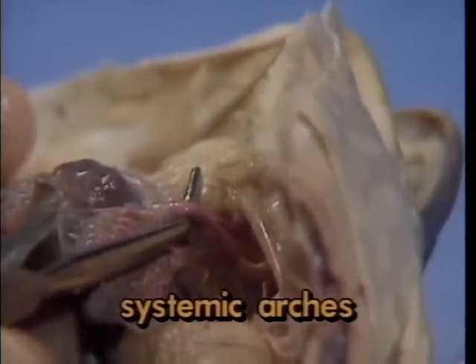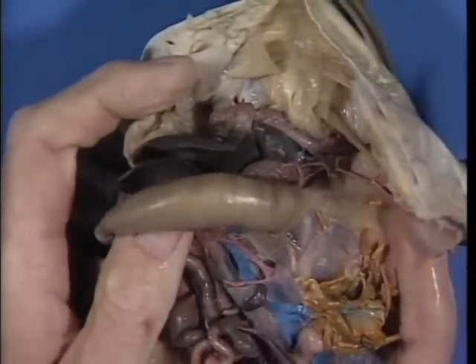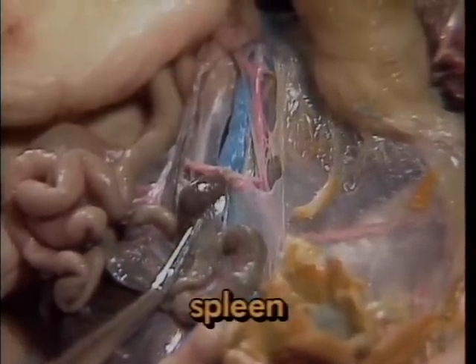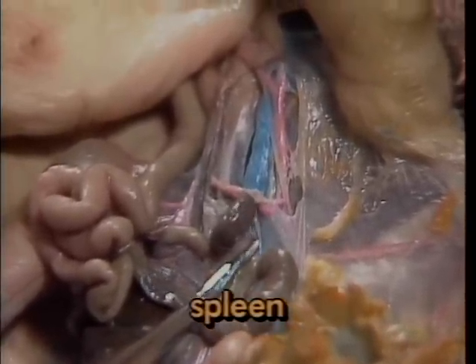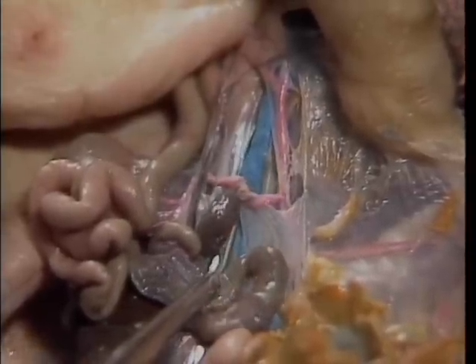Although the spleen is located here in the mesentery, beside the large intestine, and quite remote from the heart, it is an important part of the circulatory system because it manufactures, stores, and at times destroys blood cells.